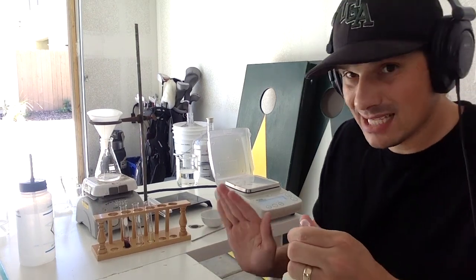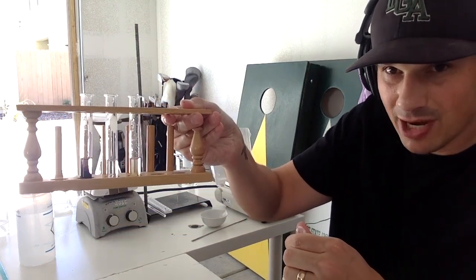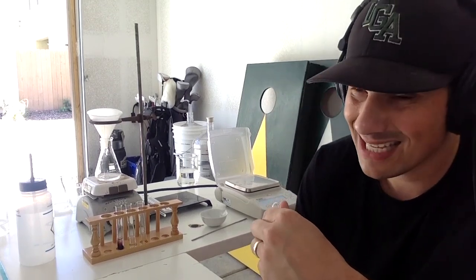So let's pause here for now. That first test tube right there is that salicylic acid. When you have those phenols in there, it forms that purple precipitate that's coming into the solution. So let's see if our aspirin is actually aspirin or if we made a horrible, horrible mistake.